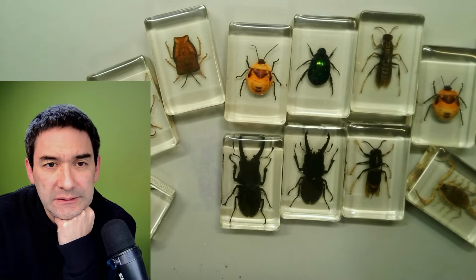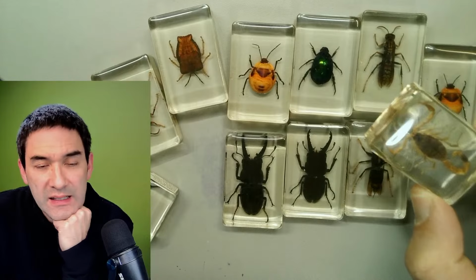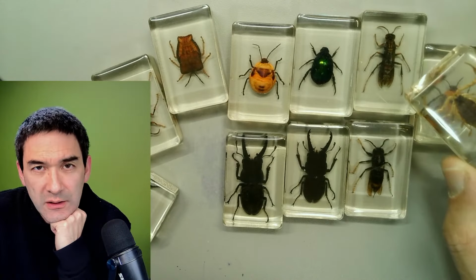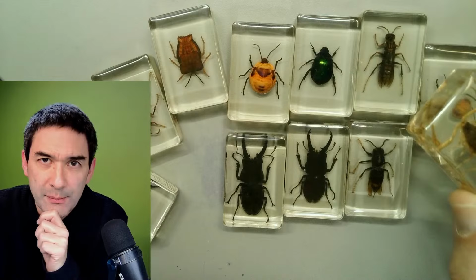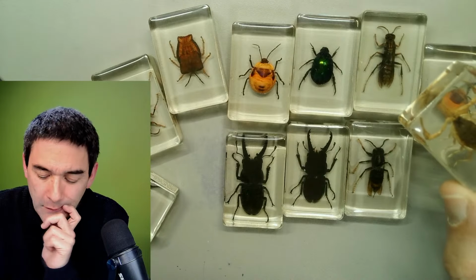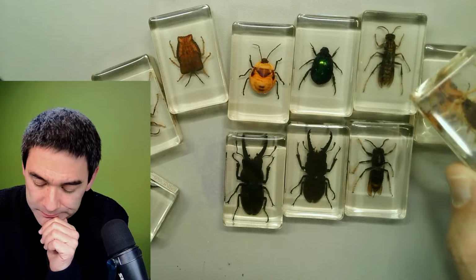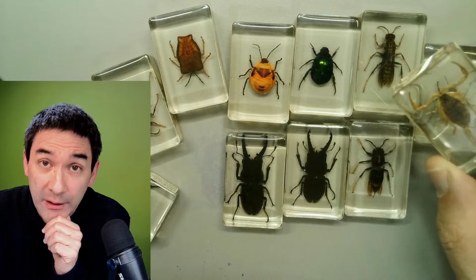However, and now this is where it becomes interesting, is there a potential possibility to use this resin also as a mounting medium for microscope slides? I don't know if anyone ever tried it out.